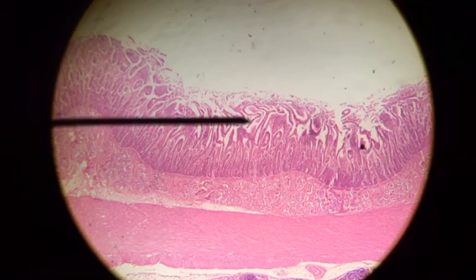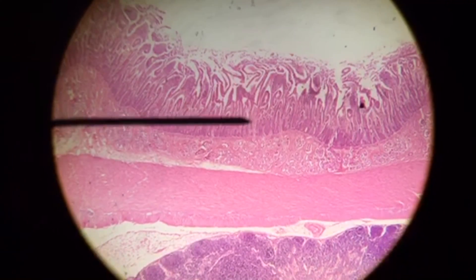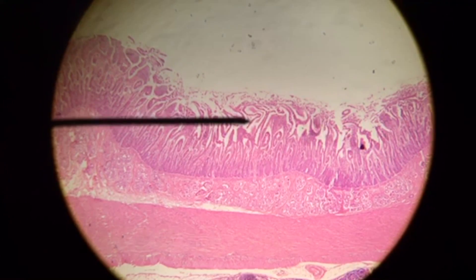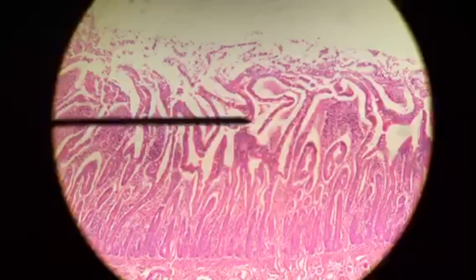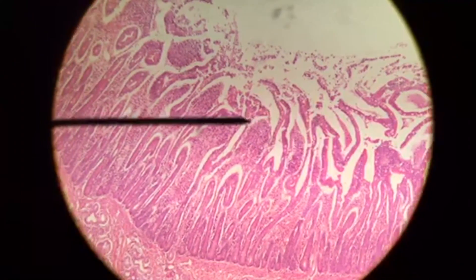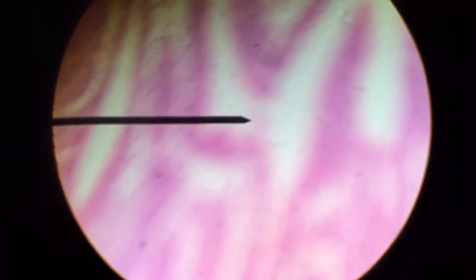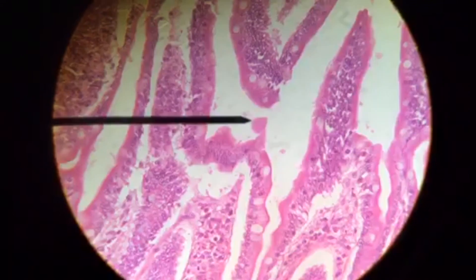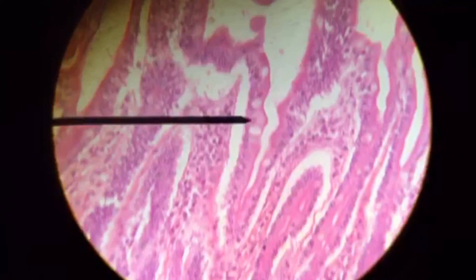We're going to look at two major portions of the small intestine. The first one is the duodenum. We can see our first layer, the mucosa, which is characterized by villi comprised of simple columnar epithelium. There are nice finger-like projections within the mucosa. Zooming in at the highest magnification, you can see the simple columnar epithelium and some nice goblet cells.